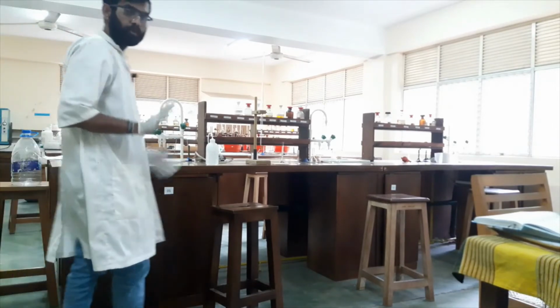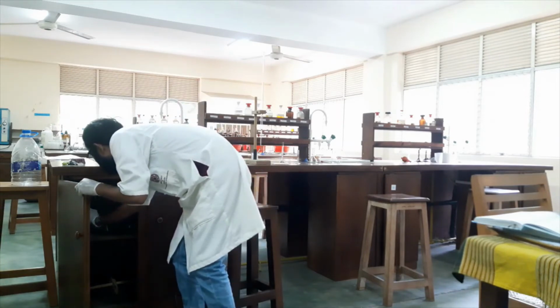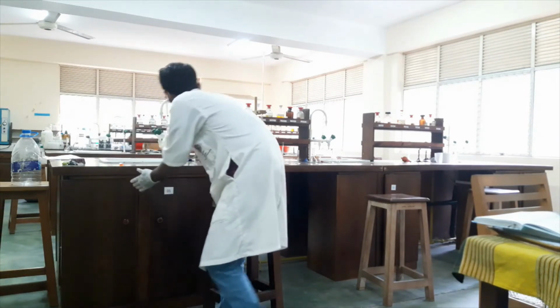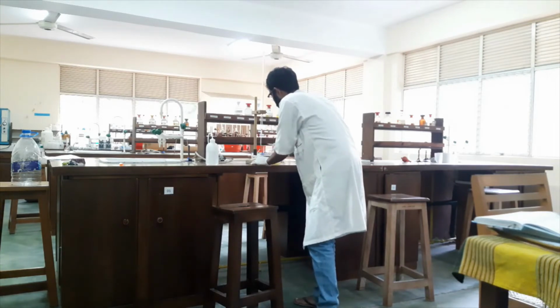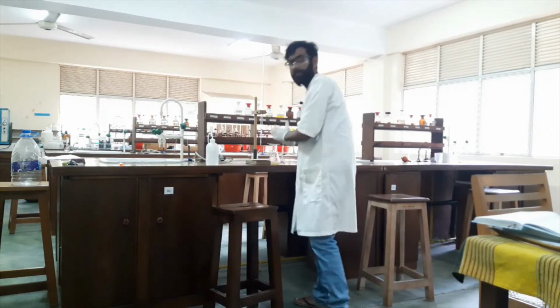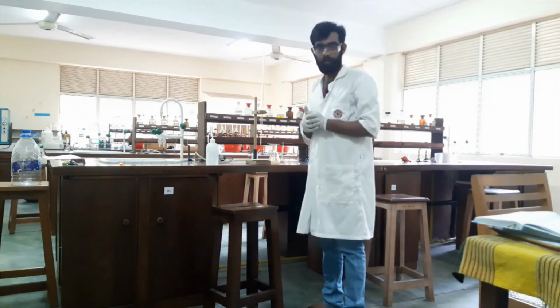Okay, now 2 minutes is completed. I will take out the solution, and now I am going to titrate this solution with our 0.01 M sodium thiosulfate solution.